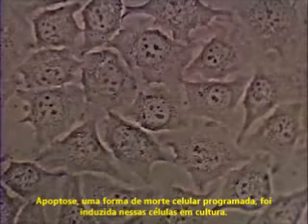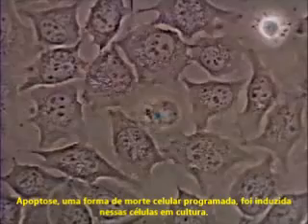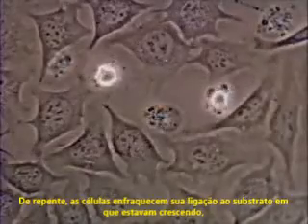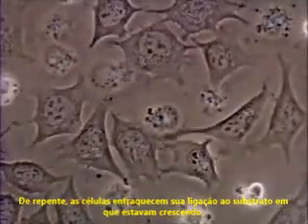Apoptosis, a form of programmed cell death, has been induced in these cultured cells. Cell death is characterized by blebbing of the plasma membrane and fragmentation of the nuclei. Cells weaken attachment to the substratum that they have been growing on and shrivel up without lysing.